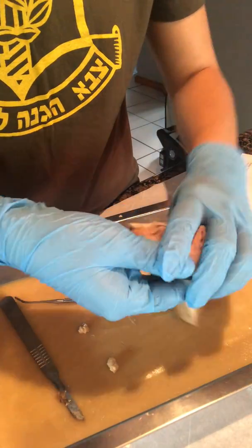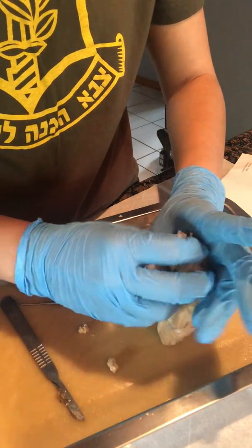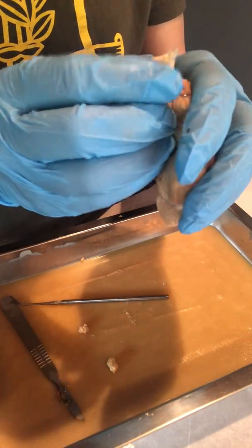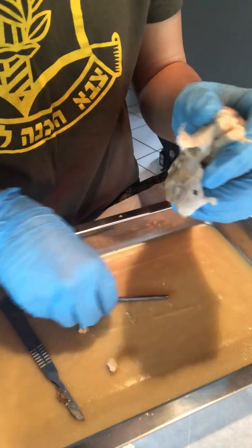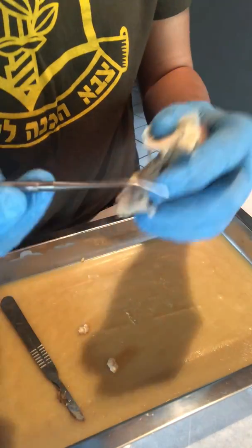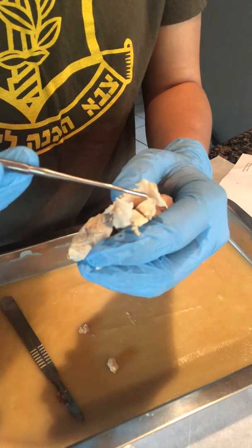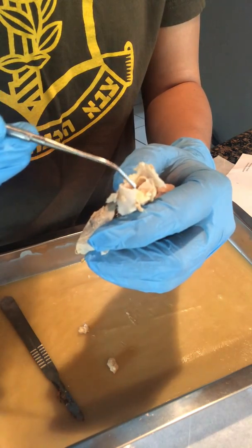And when you put the two halves together and you were to cut off the ends, it would kind of have a butterfly shape. I'm not seeing it too much in this one, but if these were put together, in the middle here would have a gray matter, and the outer portion would be of white matter.